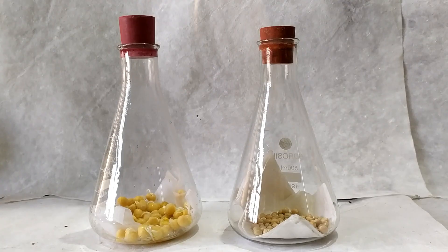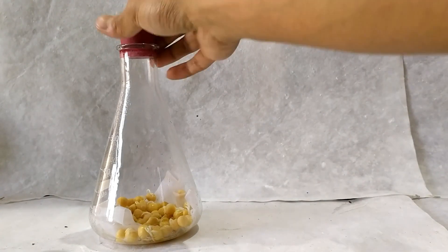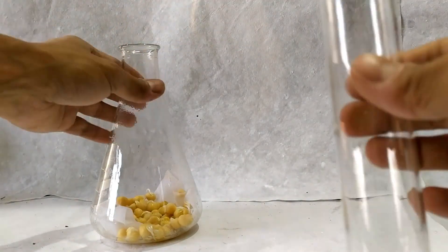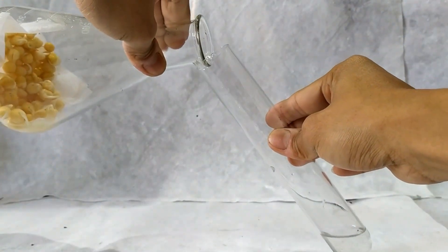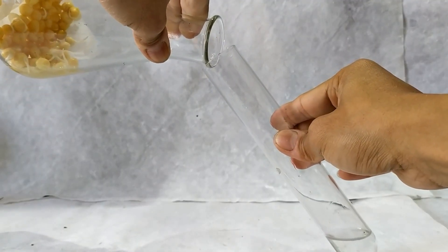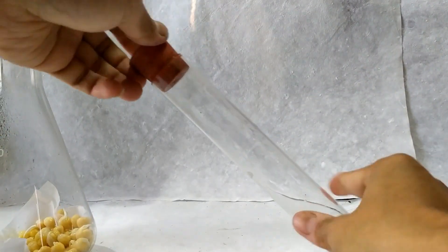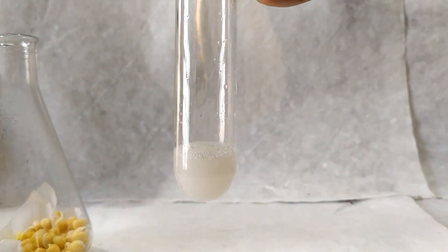Leave the two flasks at room temperature for a couple of days. After two to three days, open the flask containing the pre-soaked seeds and carefully pour the gaseous contents of the flask into a test tube containing lime water. Cover the tube with a cork and gently shake the test tube. You can clearly observe the lime water turning milky or cloudy white in color.